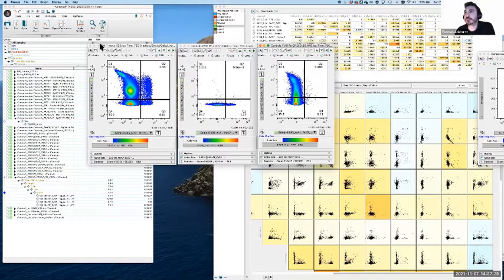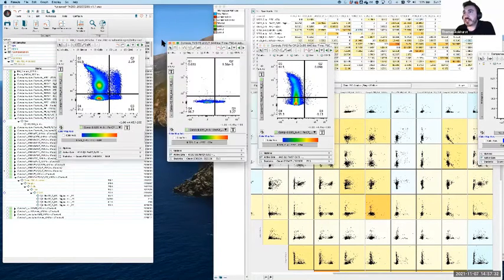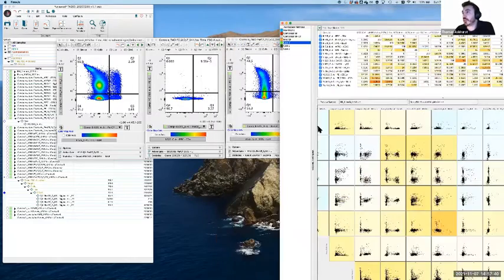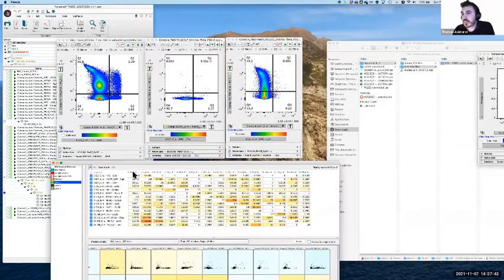So what we could do here is take these three next to each other, and importantly, they all need to have the same compensation matrix applied if we're going to make any corrections. So I can then go to my matrix, just drop it down here. I'm going to put PE-Cy7 on the left and PerCP-Cy5.5 on the right, sorry, as the column. So that's what I'm looking at here. The value here is 5.6. Now, just to show what happens, if I set this to 0, what we're expecting is this is going to move over to the right.